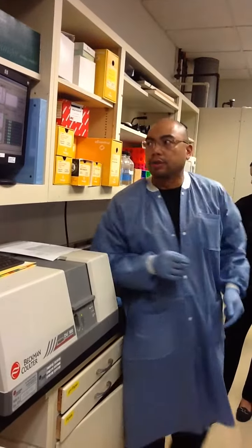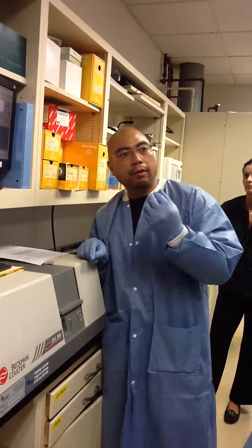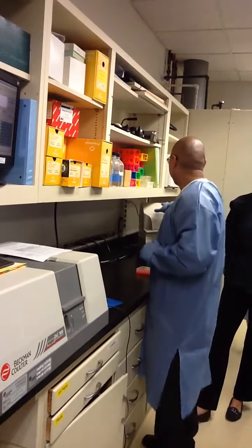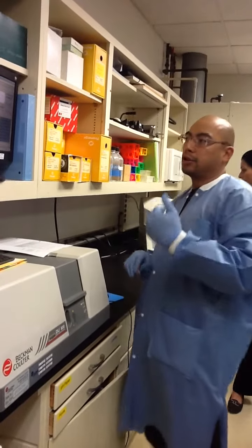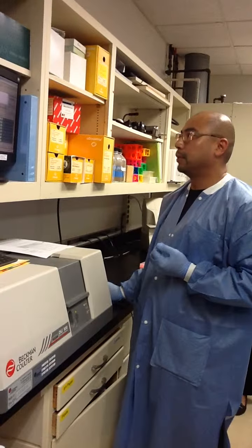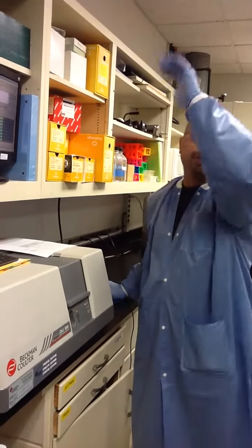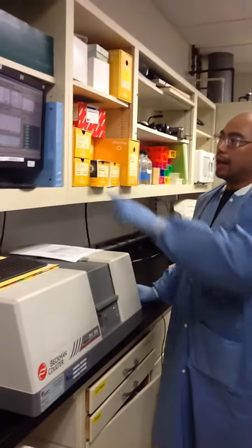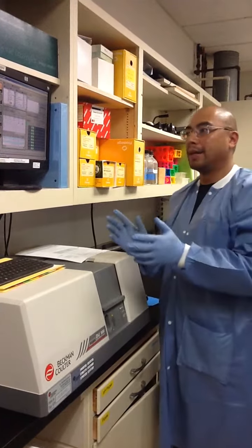What the computer is used for is qPCR, because it actually puts the data together for the optic measuring of this, the detector, which is this huge bonnet on the top. There's a fluorophore detector there that measures after every cycle. What kind of data you'll pull up, I'll show you next door when we get in there. It looks like bacterial growth curves. They're exponential growth curves.